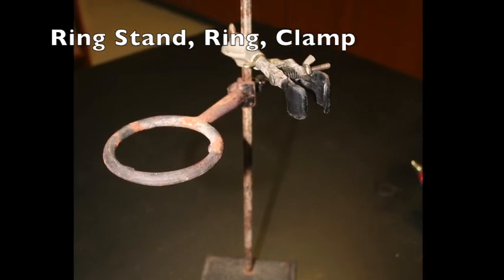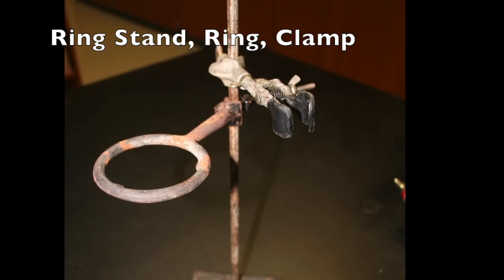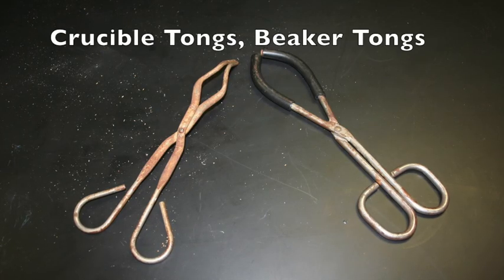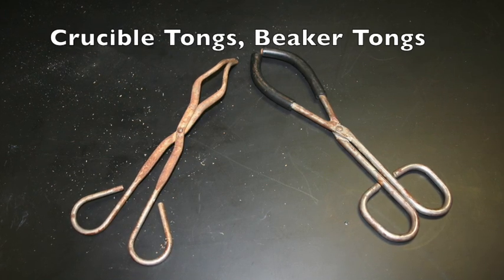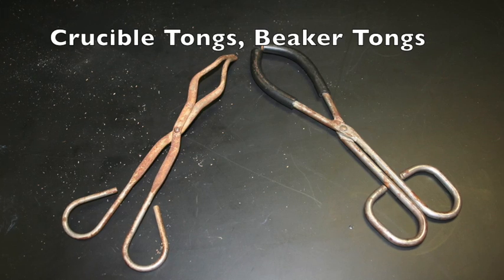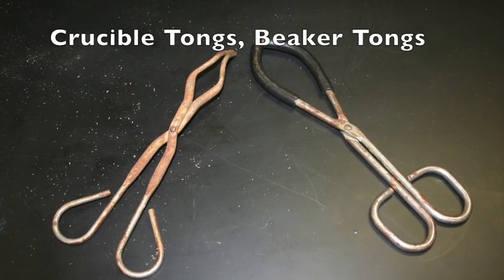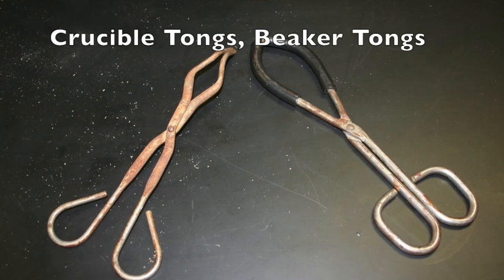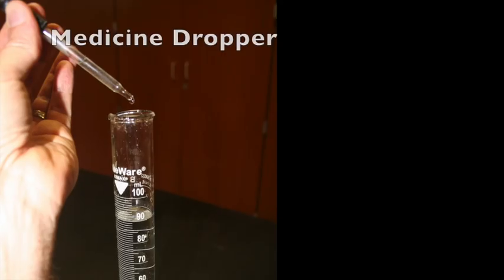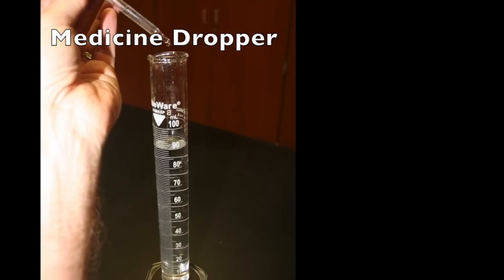Also shown here is a clamp that is useful for supporting test tubes, thermometers, or other small diameter items. On the left in this picture is a pair of crucible tongs, while on the right is a pair of beaker tongs. The crucible tongs may be used to grasp and pick up objects. The beaker tongs are designed to grab hold of the beaker so that it can be safely moved when it is too hot to handle. The medicine dropper is used to transfer liquids one drop at a time.